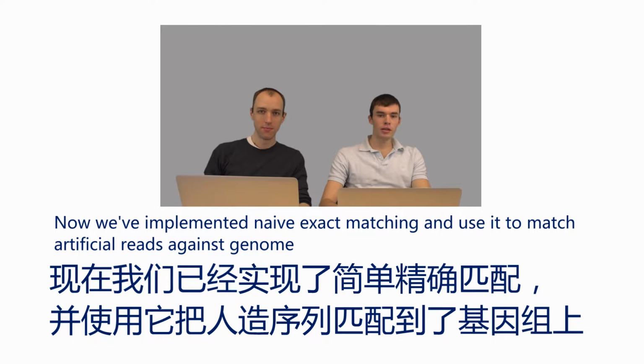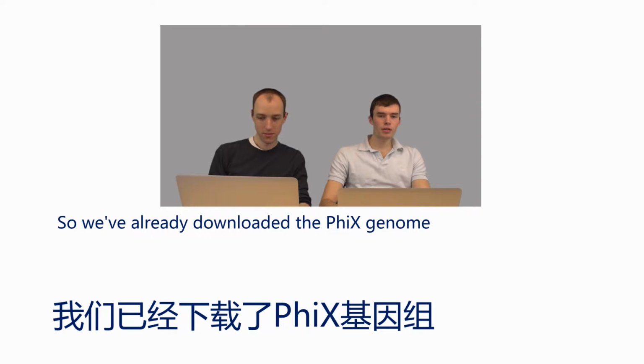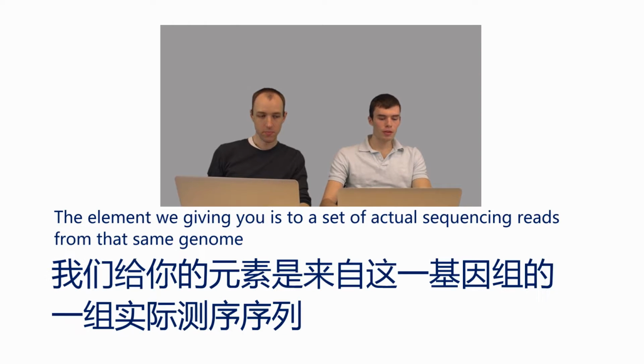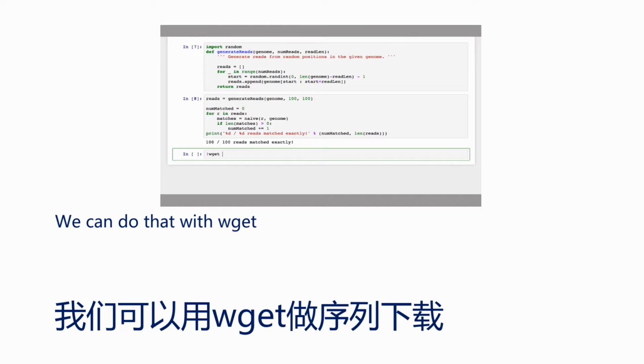Now that we've implemented naive exact matching and used it to match artificial reads against the genome, let's do the same thing with real sequencing reads. So we've already downloaded the PhiX genome. The other link we've given you is to a set of actual sequencing reads from that same genome. So you can download that. I'm going to do that with wget.